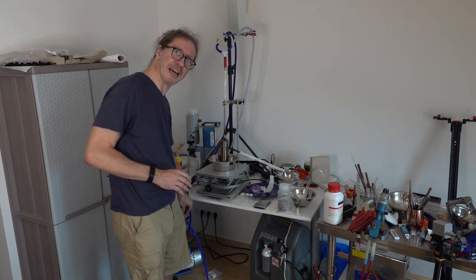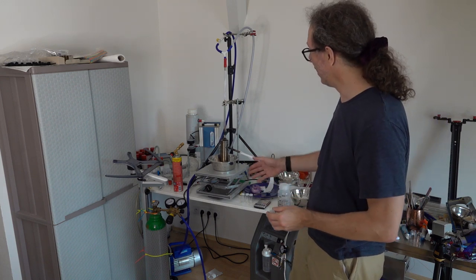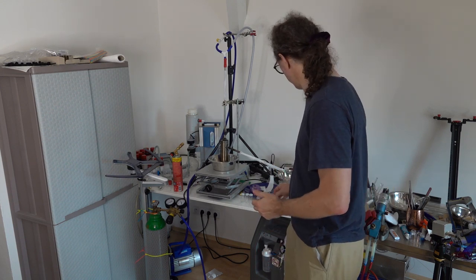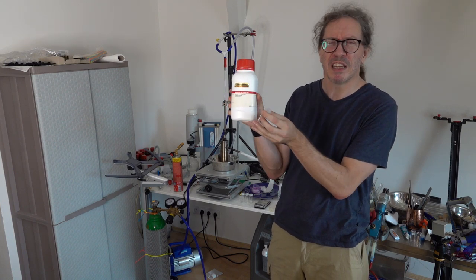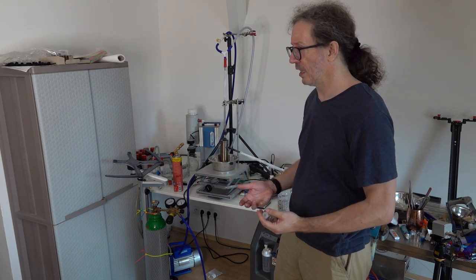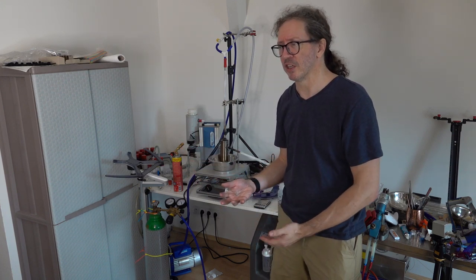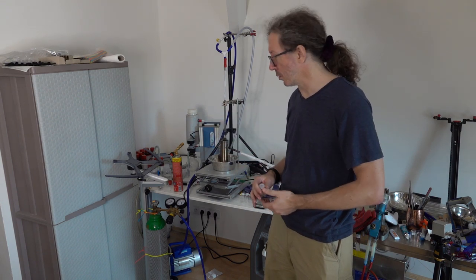Important things to plan ahead for, and this is a classic way things can go wrong and get out of control really quickly: the bottle falls over, pulls over the whole kit, and now you've got molten salt at 600 degrees, potentially catching fire. And this is one thing that I'm hopeful about, is once you get this stuff at 650 mixed up with lithium, it's now a more dilute solution. I don't think it'll catch fire. Even in the worst case scenario, even if it does, there's a limit to what can go wrong. When it burns, it releases about the same energy as butane burning. So it's got a really limited scale for causing problems like that.